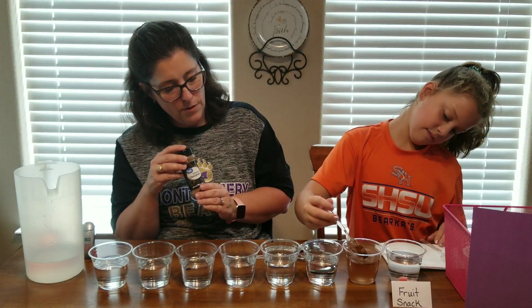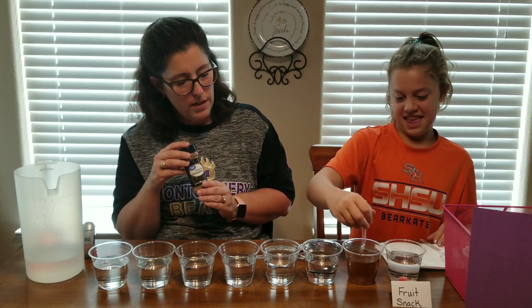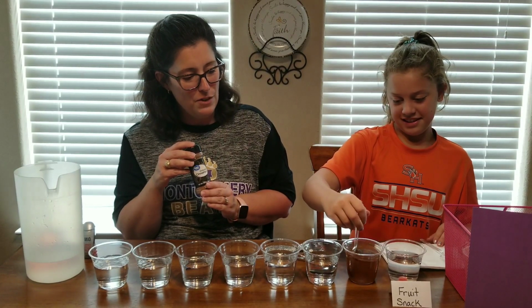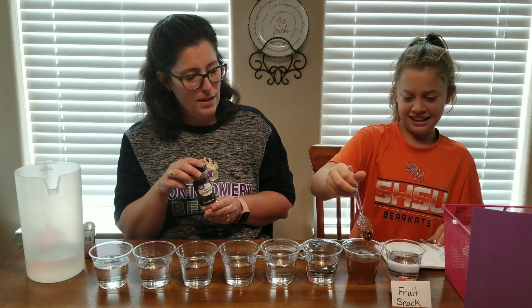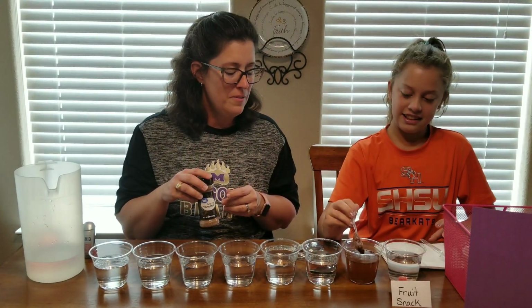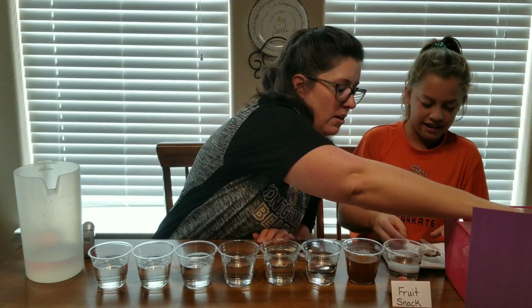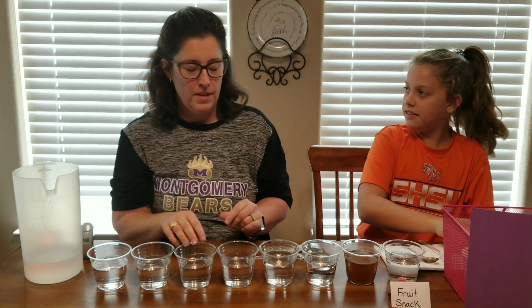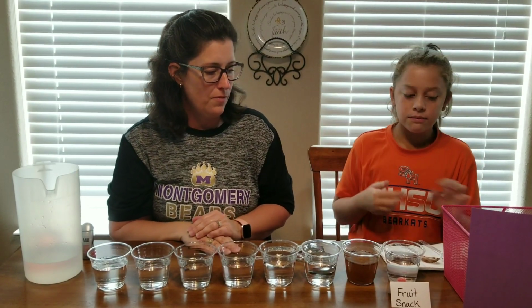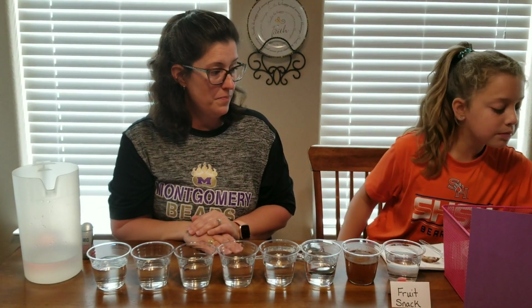If you're able to see from there, the water is darkening up a little bit. And there's some stuff on the spoon. Hold that up, Carly, so they can see. It's gross. Oh, goodness. All right, set that on the paper towel. And we'll go ahead and put our label with it. We can wash the spoons later. I can take them back to my lab. We can reuse them if we wash them. All right. Do you want to put a label on it for us?